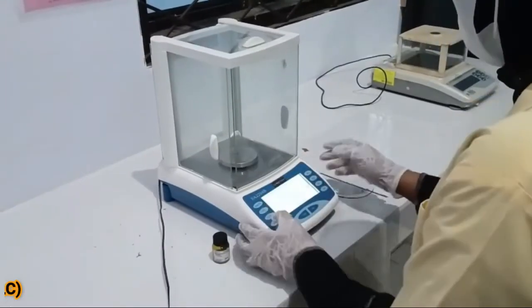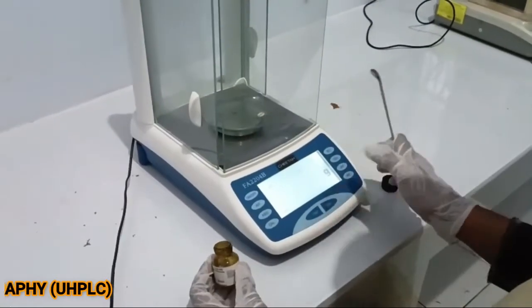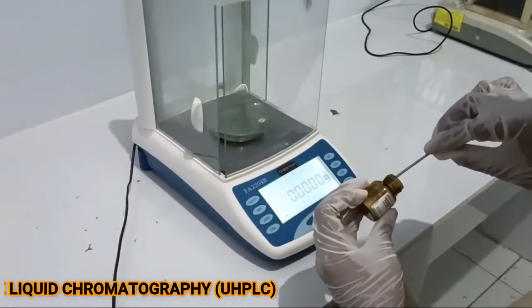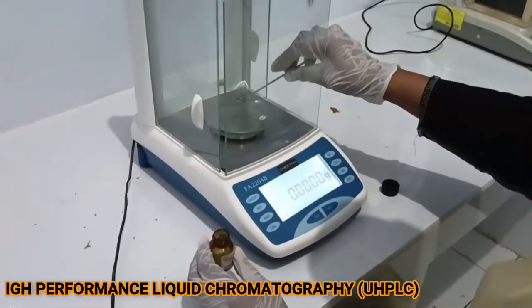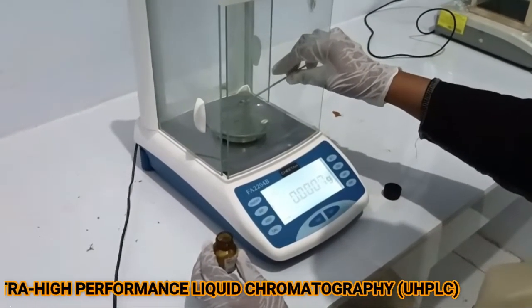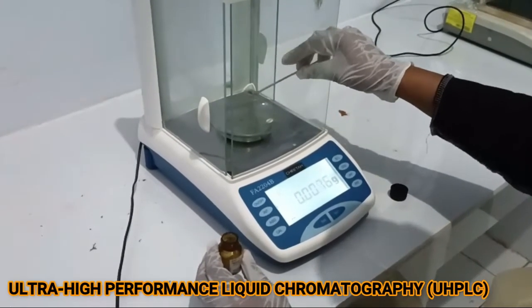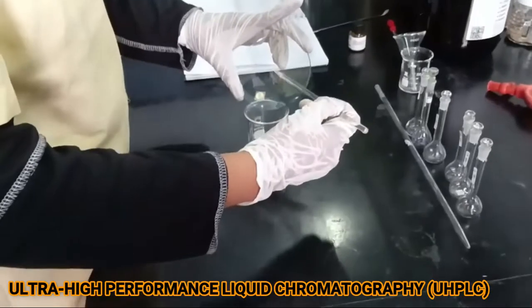In this experiment, students are expected to be skilled in conducting sample preparation and using HPLC instruments to measure qualitatively and quantitatively the compound content of a sample based on differences in the polarity of the compounds in the sample. These experiments support courses in organic chemistry, biochemistry, food analysis chemistry, and environmental chemistry.